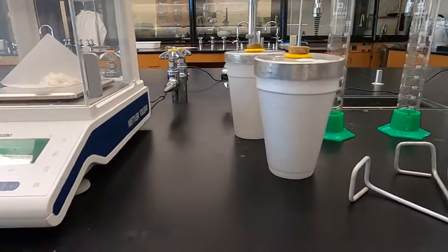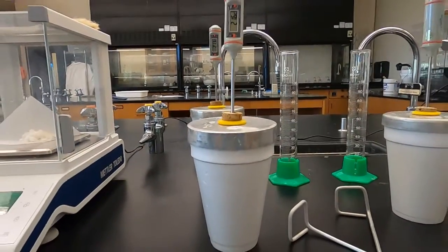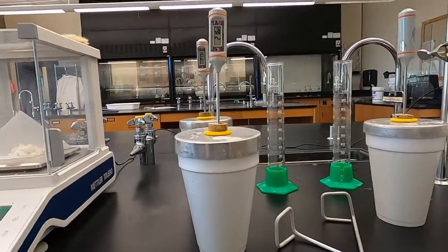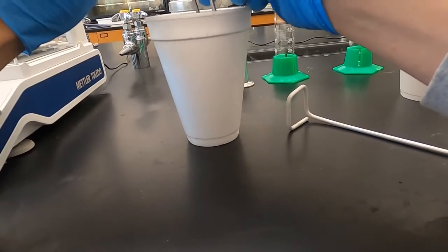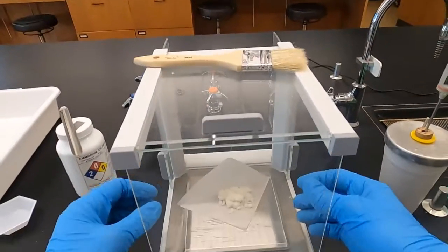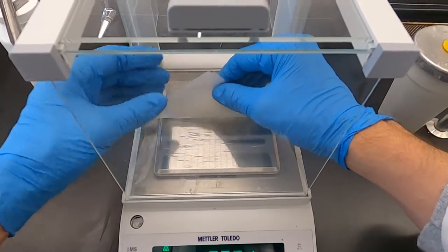Let's get this in the cup. While it heats up, we will measure out the calcium chloride while keeping an eye on this, so we're not just sitting here watching the thermometer the whole time. If you were in the lab, you'd be a little more careful if this was your first time doing this. I have done this a few times, and so I'm able to keep a better eye on it. And here we go. So we're getting our sample out. Before we pour it in, I'm going to note what the temperature of this water is so that we can get our initial and final temperature.